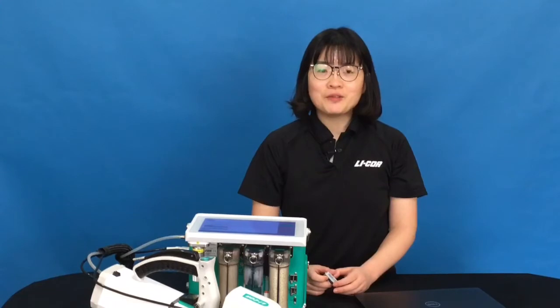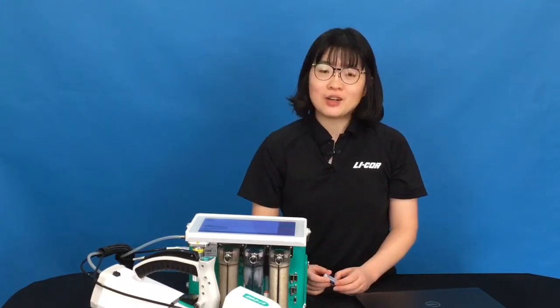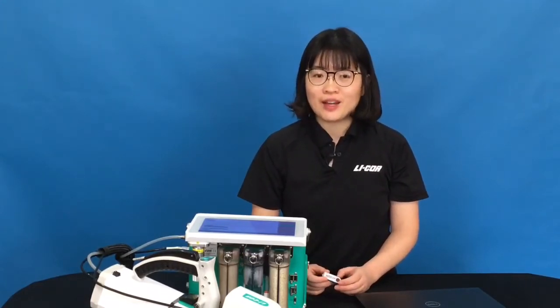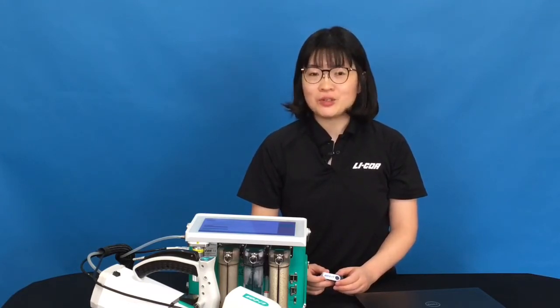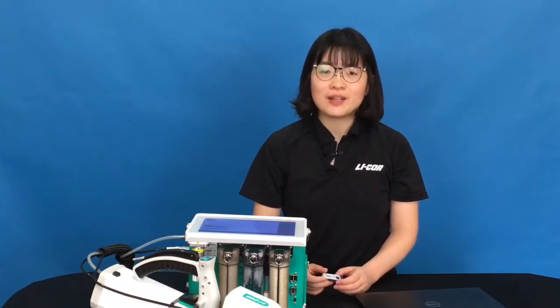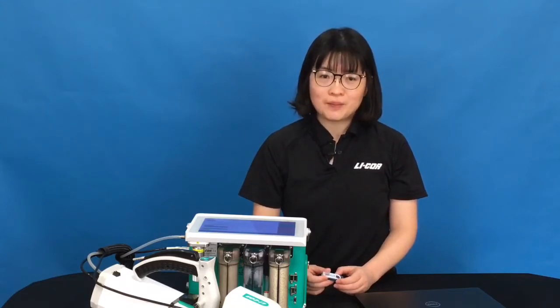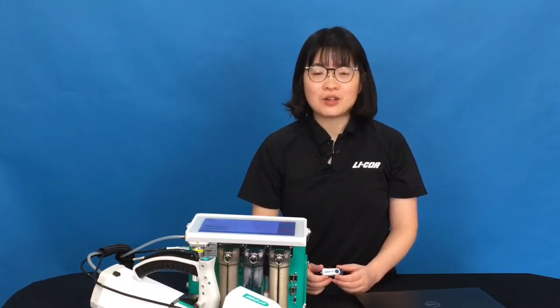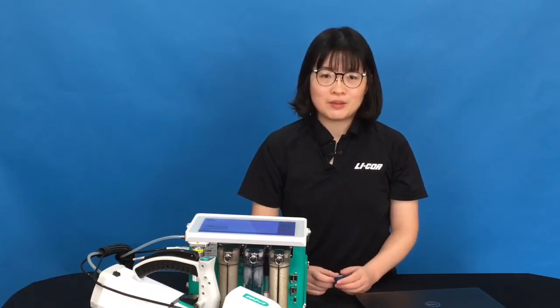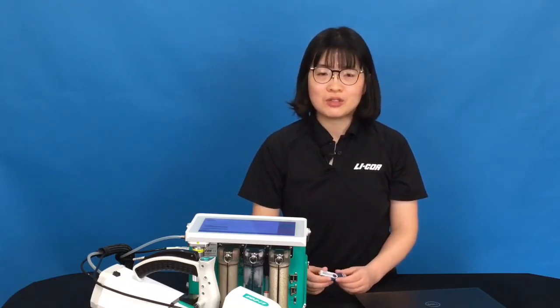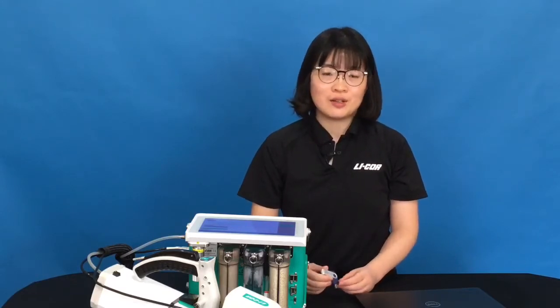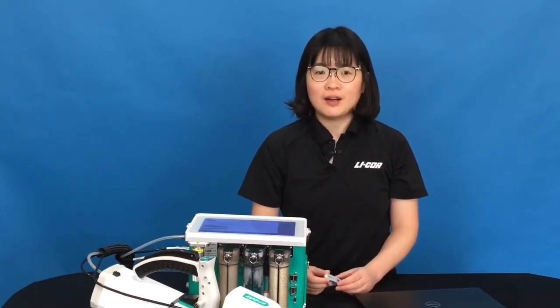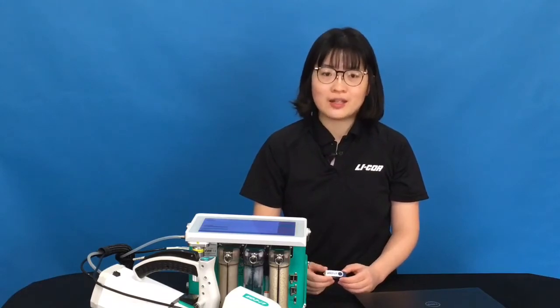If you find your USB storage device is not being recognized by the LI6800, we will suggest you to check the embedded software to make sure it is the latest one. We have the software available on our support website. You can just go to the support website to check the latest software, so make sure your instrument has the latest.